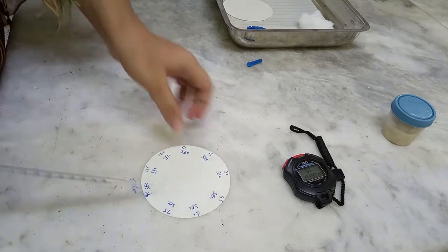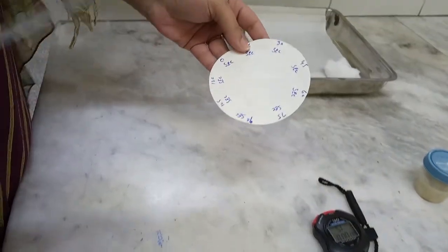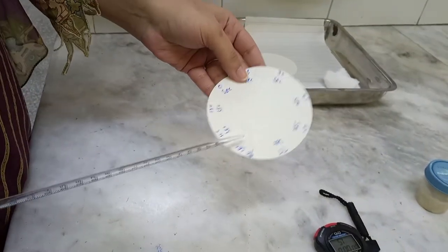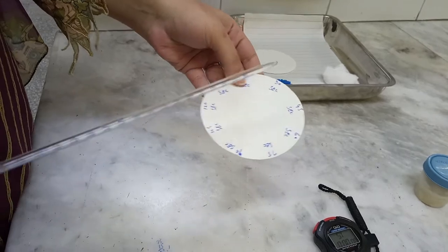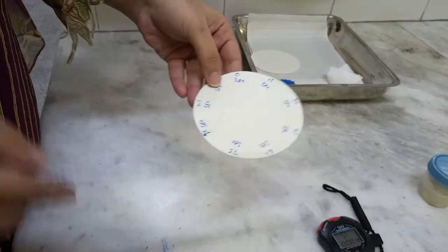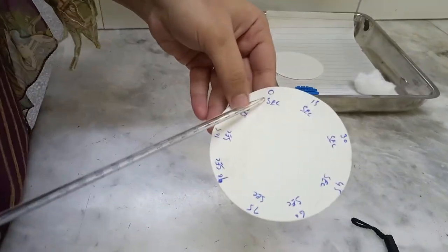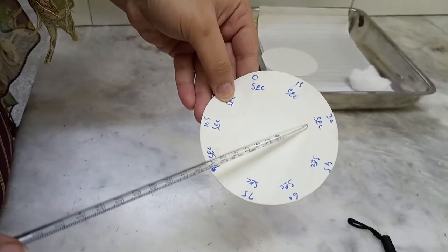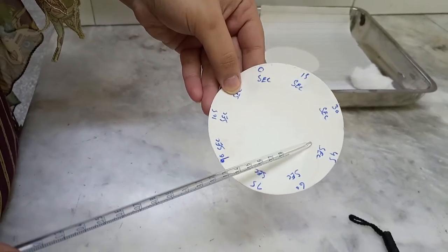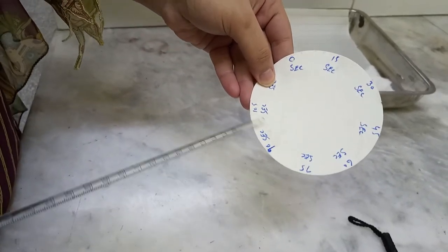This is the filter paper. For your convenience, you can mark the filter paper before the experiment starts. You will mark 0 seconds, then 15, 30, 45, 60, and so on.